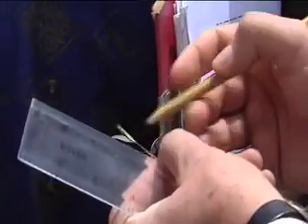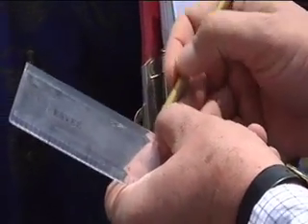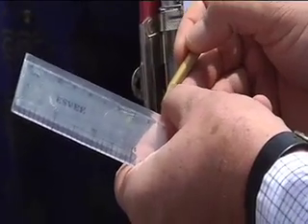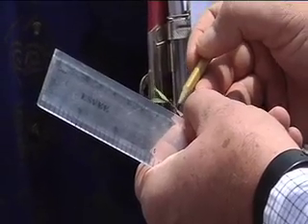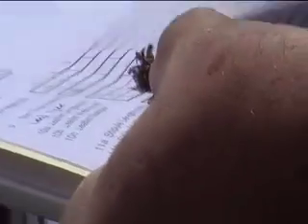This part is the stipule base, and some of them are of different shapes. This is the stipule head — the tips. Flower length: to measure a flower, you need to dissect it and take one flower for measurement.